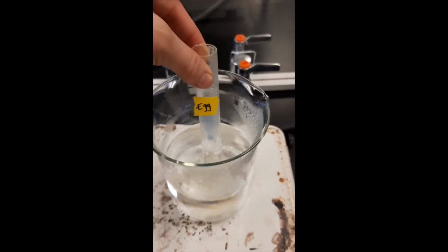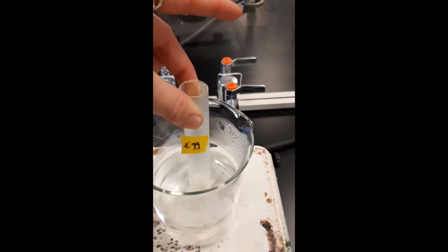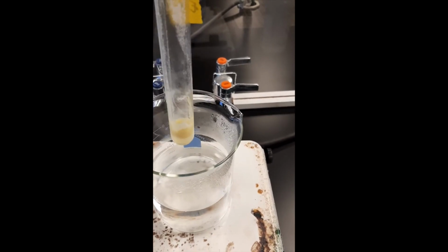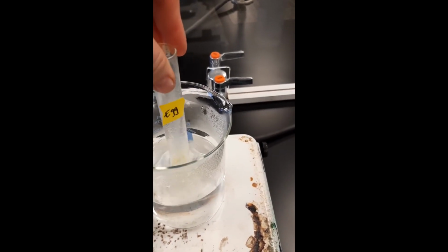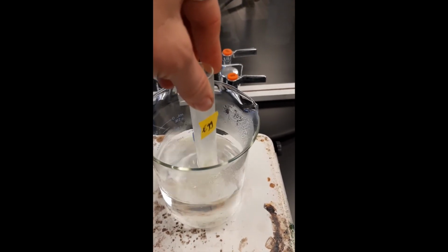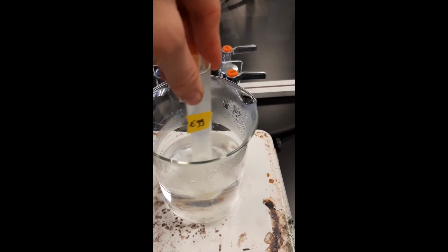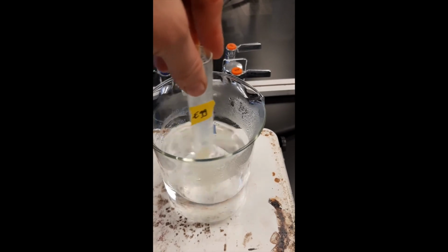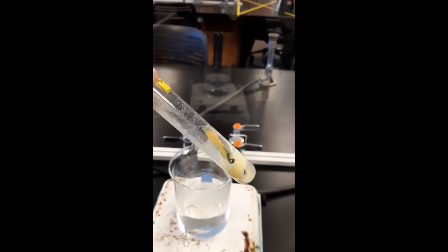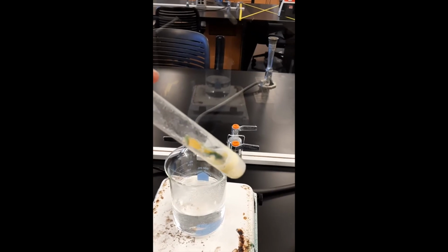My next variable is the egg. And here I can smell a bit of the ammonia being produced. Now I put a bit more concentrated solution and a bit more content in here than I did for the milk. Milk is also going to have a lot of water and a lot of carbohydrates in it as well, whereas this egg yolk is almost 100% protein with some cholesterol. And we do get a blue change in our litmus paper, again indicating a base.